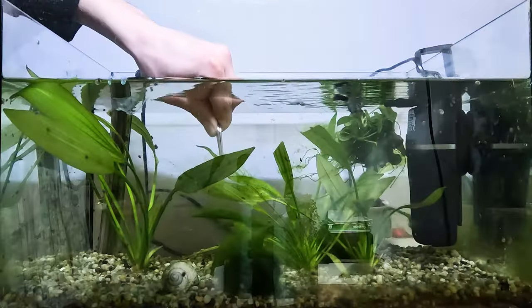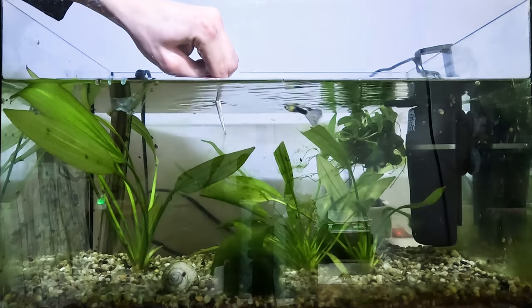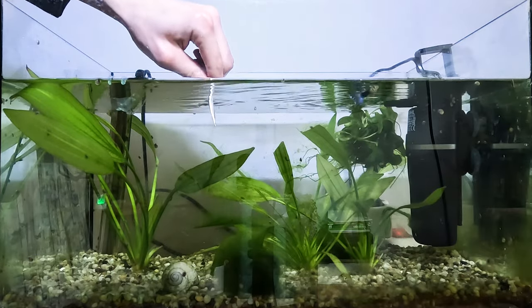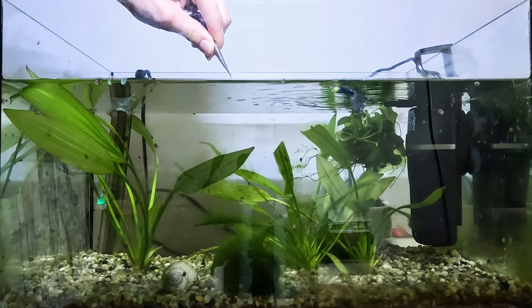So I've decided to get some samples from my aquarium and we're going to look at them under the microscope. I'm going to start with getting a bit of algae from the aquarium — just a few strands of it — and here it is.